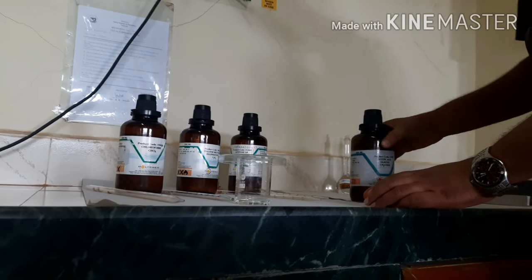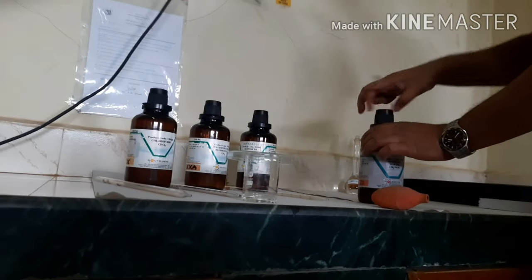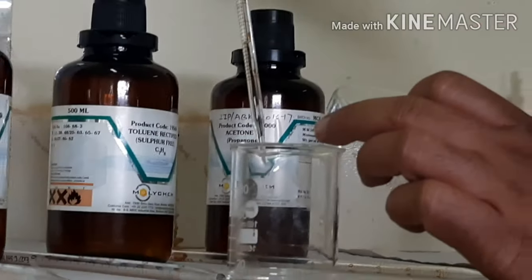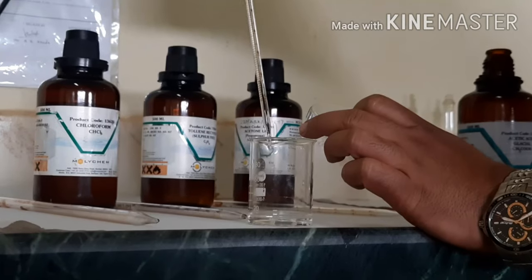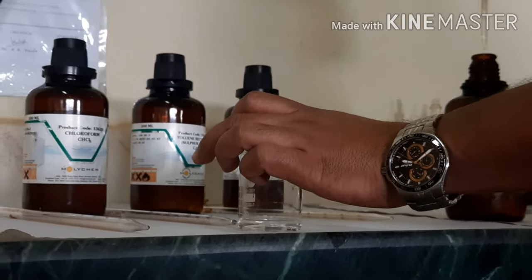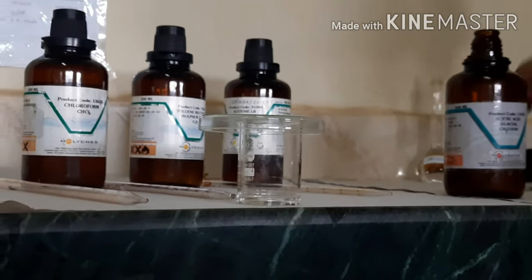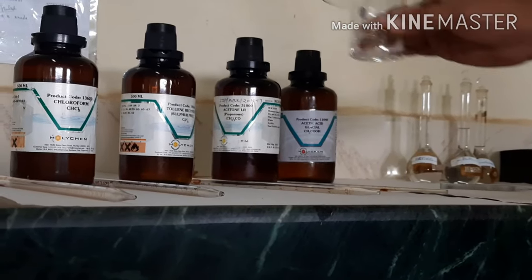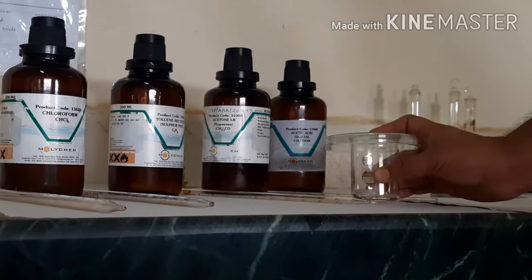The last solvent is glacial acetic acid at 0.1 ml. If you're able to measure 0.1 ml accurately you can do so, otherwise just add 1 drop of acetic acid. We added 2 drops of acetic acid. This is how we have prepared the solvent system; we shake the beaker and now set it aside.